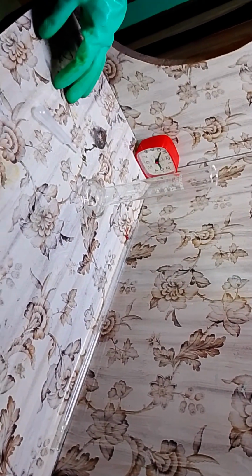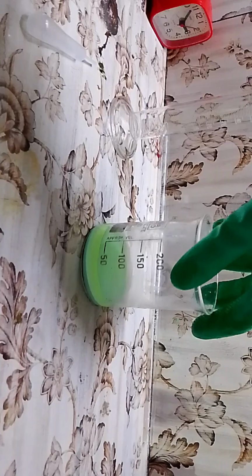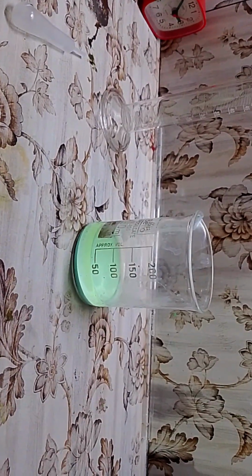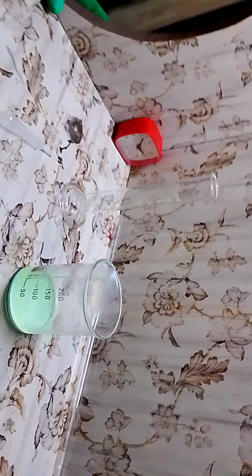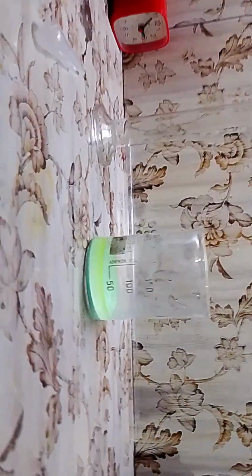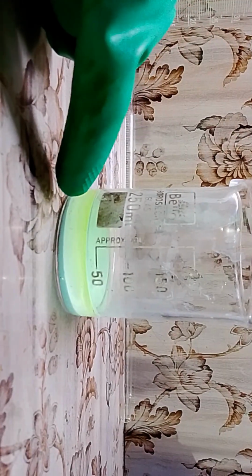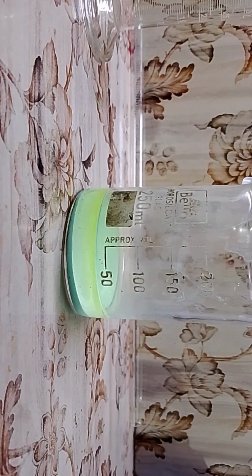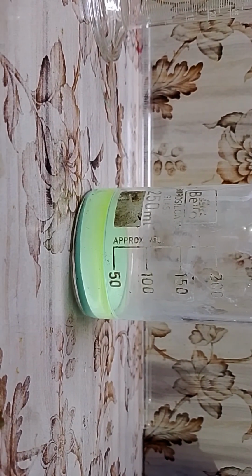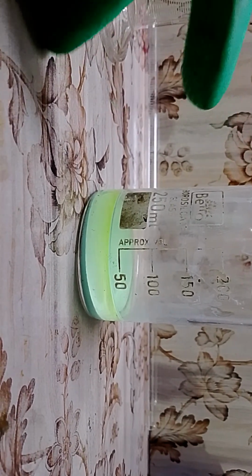And here is the beaker. I've lost a little bit of yield because most of it got absorbed by the filter. I'll ask the cameraman to lower the camera to show the acid down here. You can see it's a little cloudy here because some of the copper oxalate is sticking to the wall and it is not in the solution.